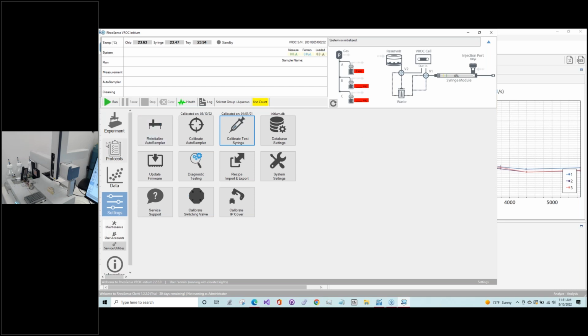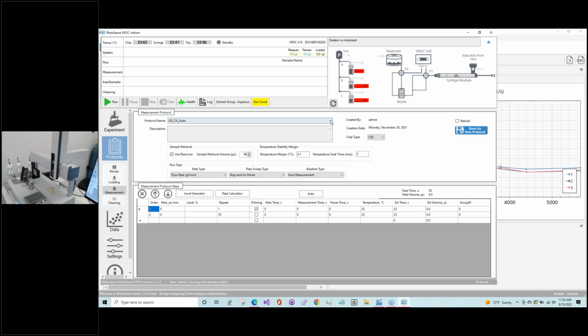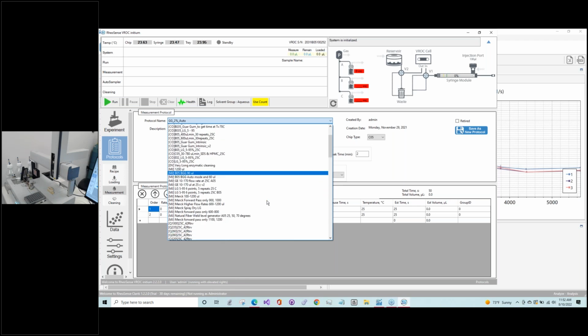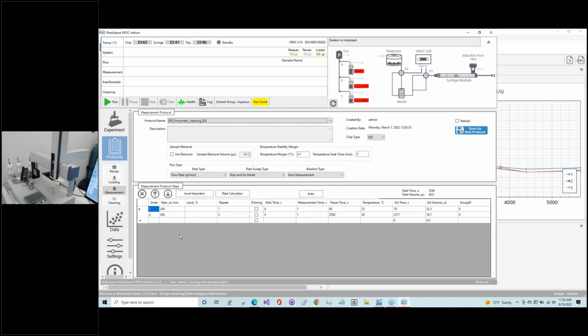Let's see if we can find it. So we go protocols, measurement, here we go. So we'll have some pre-installed protocols to deal with these enzymatic cleaners. It's under measurement protocols because, as I said, it's loaded as a sample.